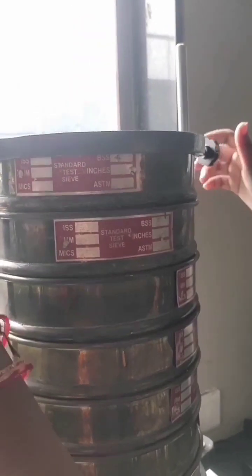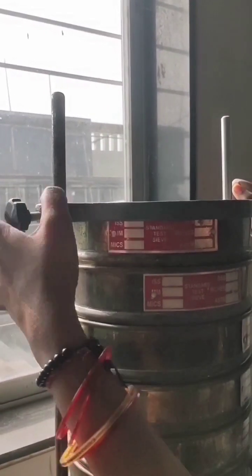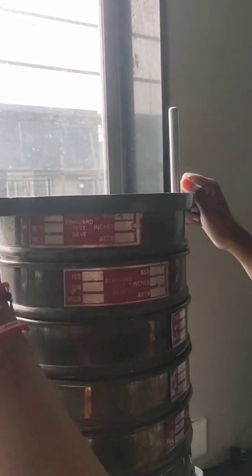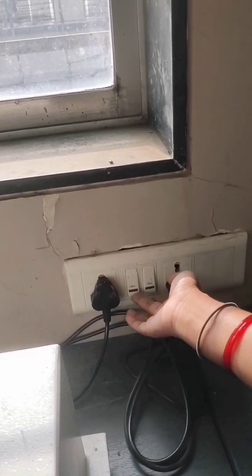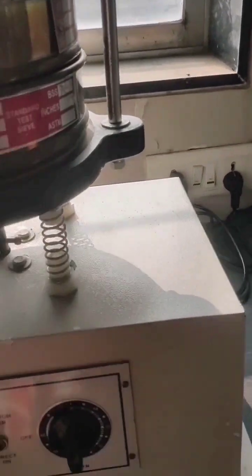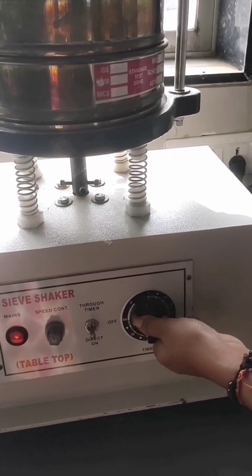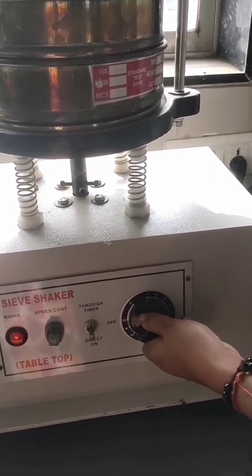Now we have closed all the sieves with this knob. Now we will turn on the switch and we will set it for 10 minutes.